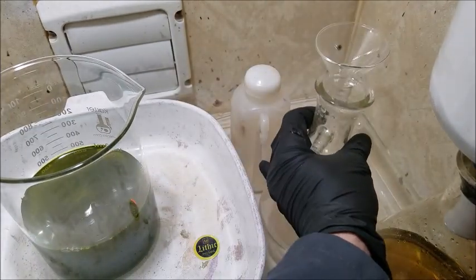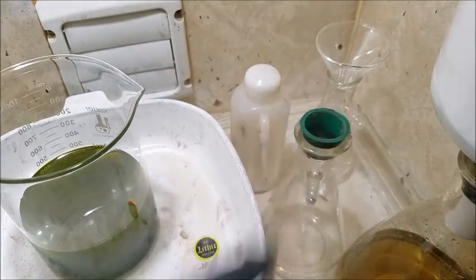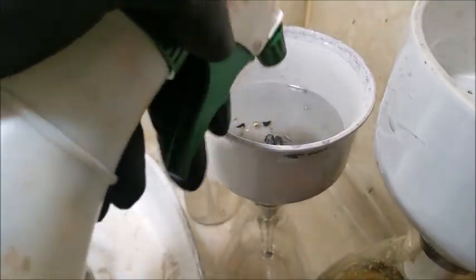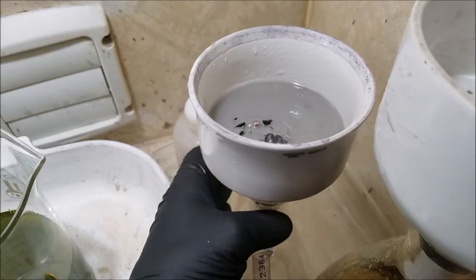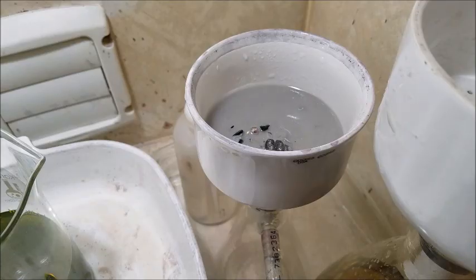Of course, that made precipitate come out. Or just a reaction, I don't know. I do know that this needs to be fully rinsed. Attach the vacuum again. I'm going to let that pull through a couple times, and I'll pour that rinse water off.